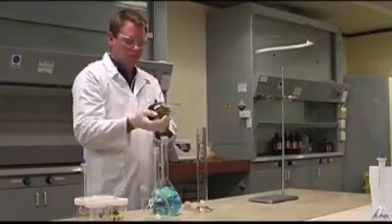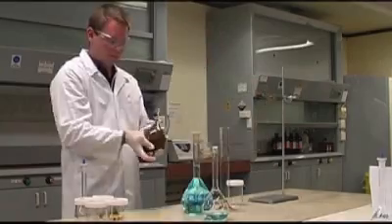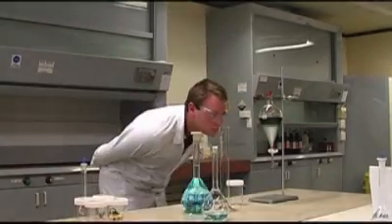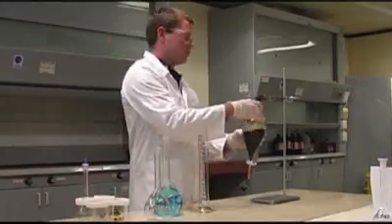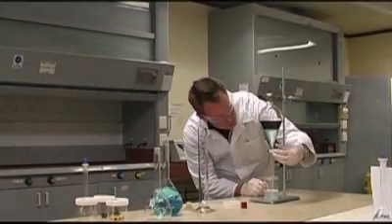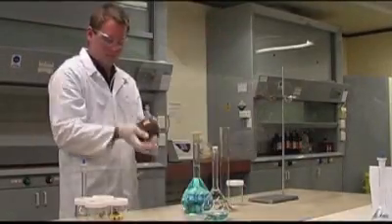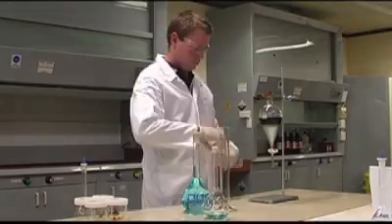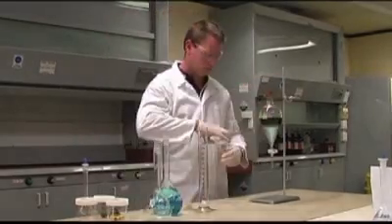If the organic phase is mixed again with fresh PLS, even more copper cations will be chelated, further enriching the organic phase with copper. Sufficient contacting steps are undertaken to ensure that the organic phase is loaded to optimum capacity with copper. So what you're saying is that we do it over and over to get as much copper as we can. That's right. Now let's observe carefully as we conduct the same procedure a further five times, then we'll take a closer look at the copper ion concentration at the end of each phase.